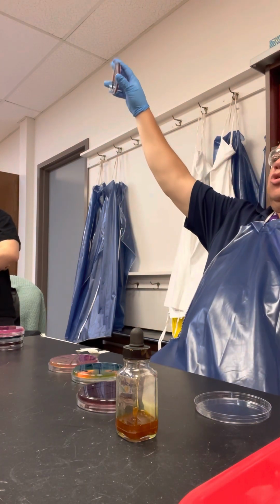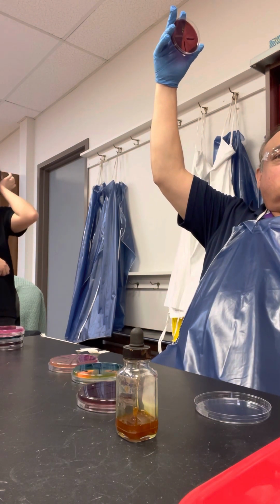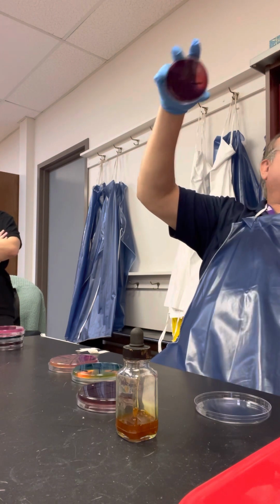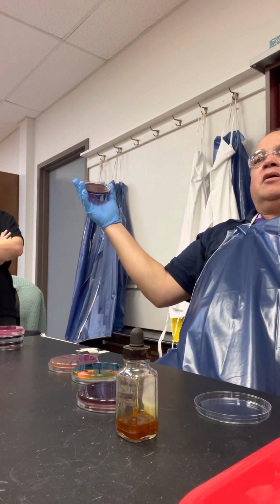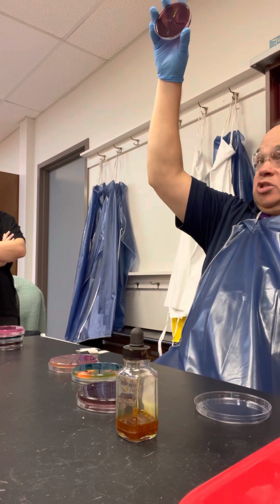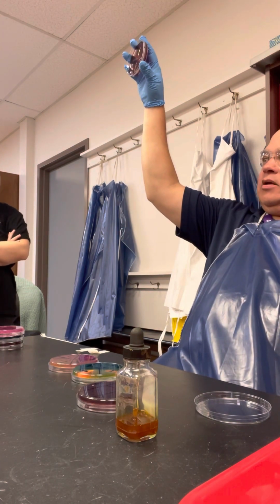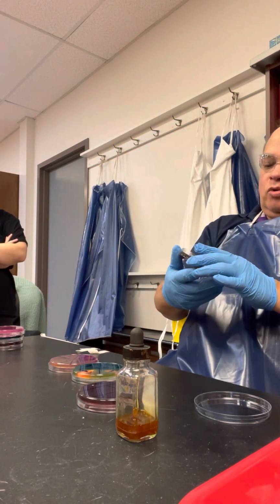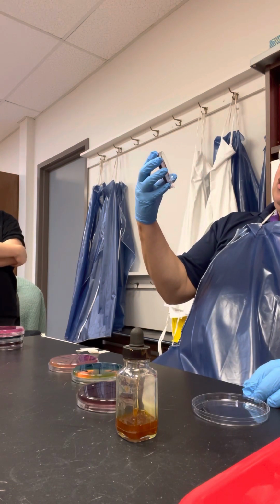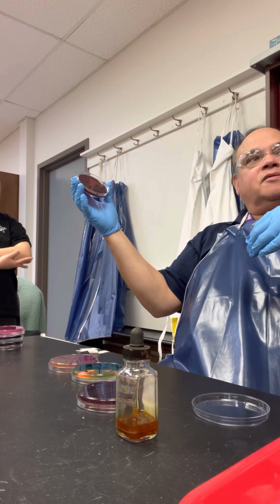And so remember, EMB is used for what? Water testing, for which organism specifically? E. coli. Not stools, fecal samples. This is for water. And the metallic green is E. coli. The other organism that's growing on here is Proteus, and it doesn't have a color, right? And so you can see that there's a lactose positive, lactose negative. It shined really pretty, that green.